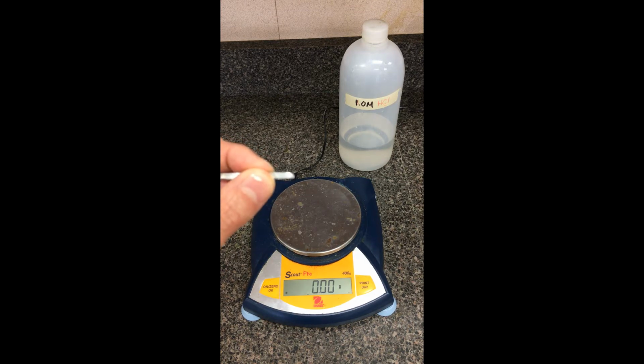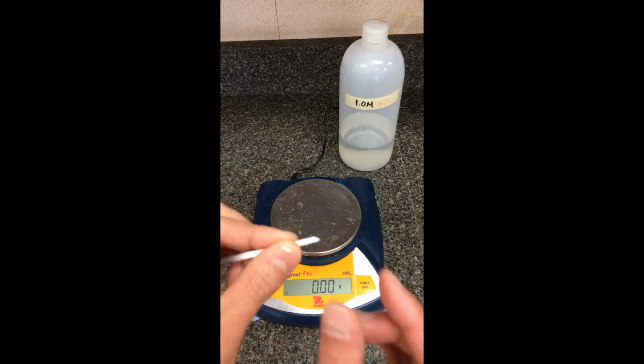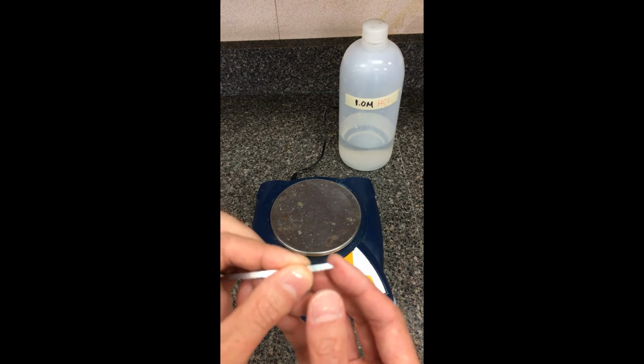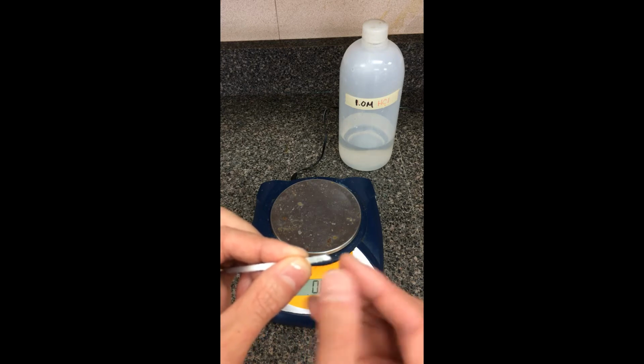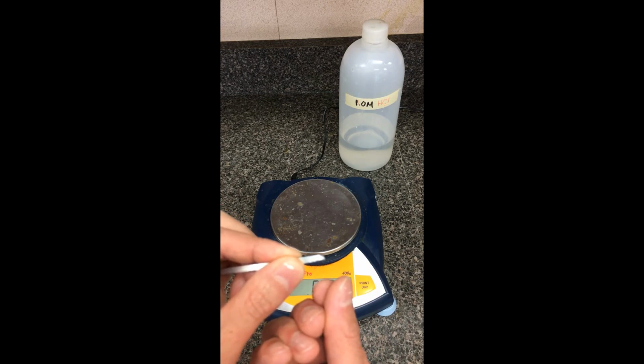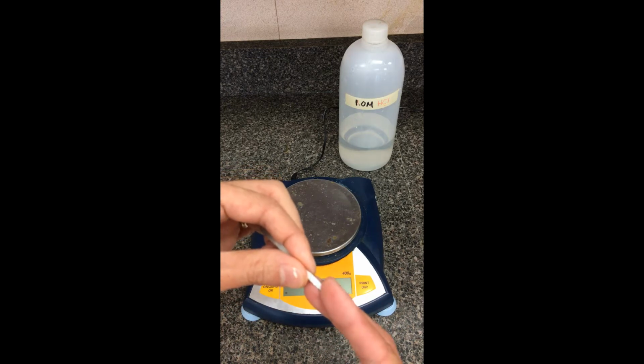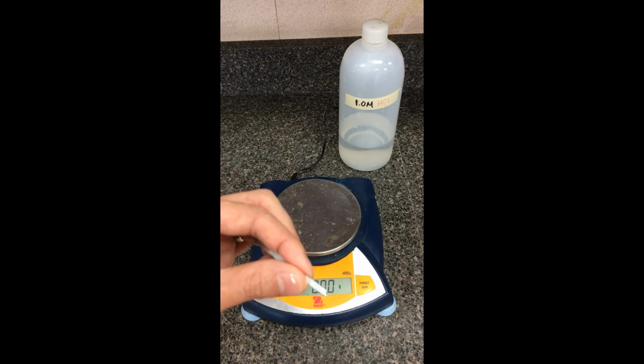Again, we would have ripped it up into 1 centimeter fragments here. We're going to try to play around with the surface area by trying to roll this piece here. Now this one here isn't overly strong, so if you make the curl too tight here, it sometimes does snap on you. I'm also going to take a pair of scissors and try to cut little slivers of this here, hoping to increase the surface area to see the impact in dropping in acid.